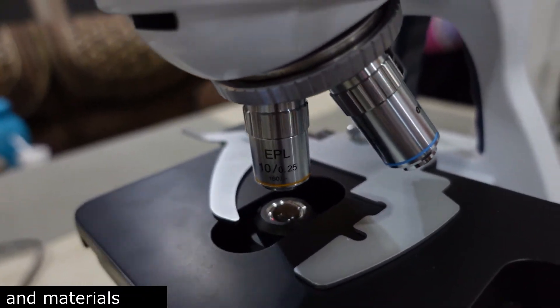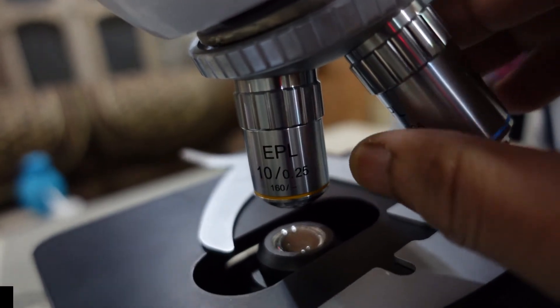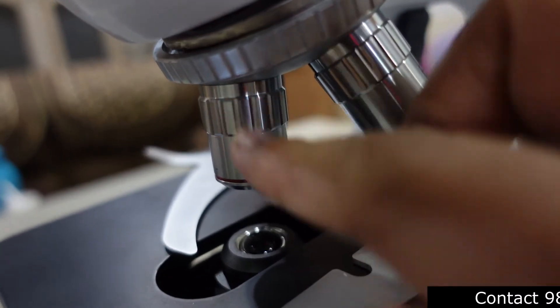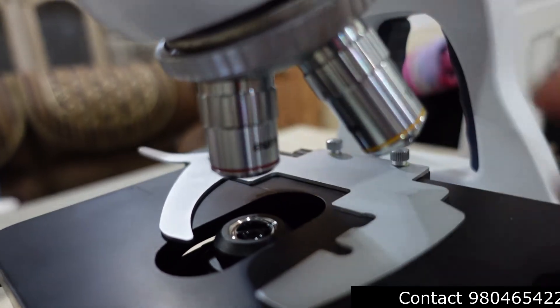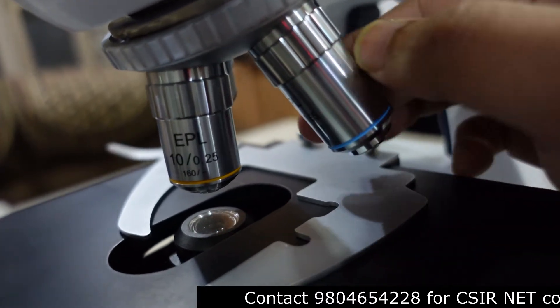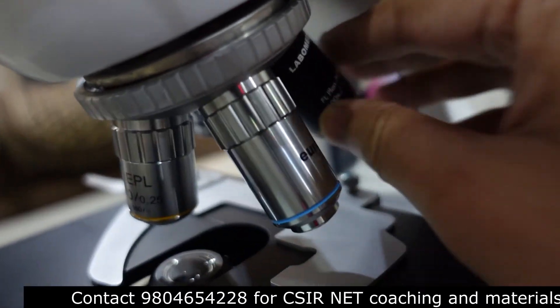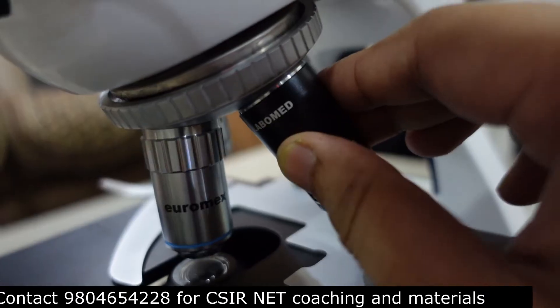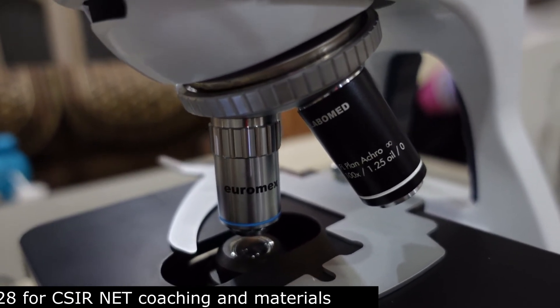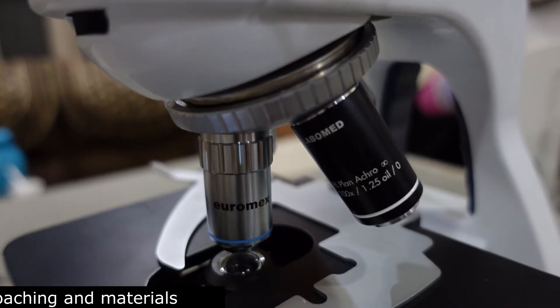Then comes the objective lens — very, very important. The nose piece holds all objective lenses, and in a research-grade microscope there are always four objectives: 4x, 10x, 40x, and 100x, arranged in clockwise order. The role of the objective is to magnify the specimen and form a true, inverted image.